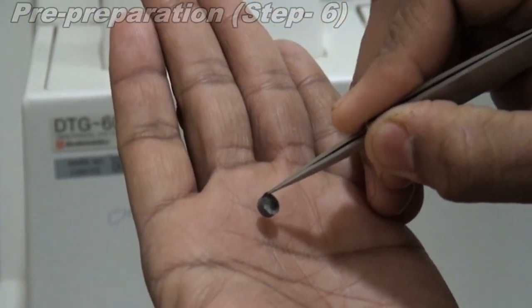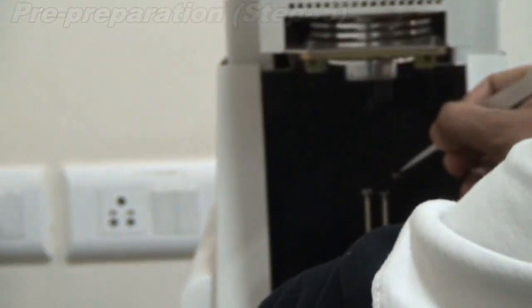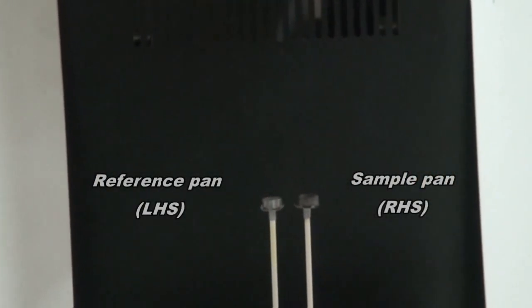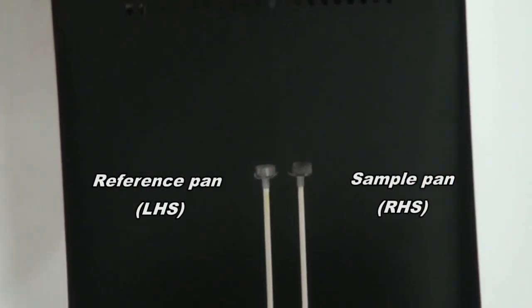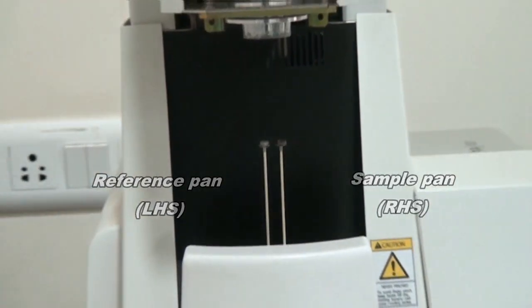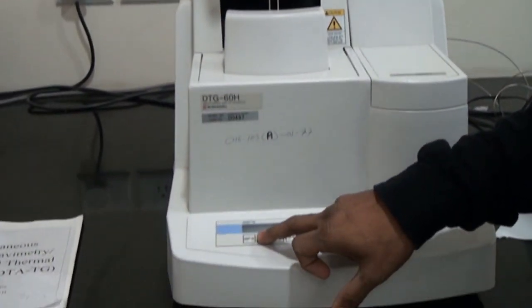I just checked it. You need to check whether the sample pan is clean or not. As per your manual, the sample pan is placed on the RH side and your reference pan on the LH side. Then I need to press the close and open button.